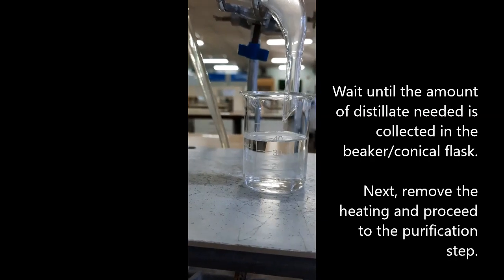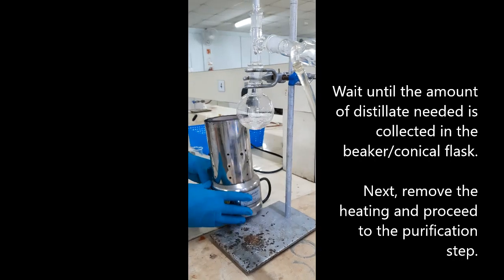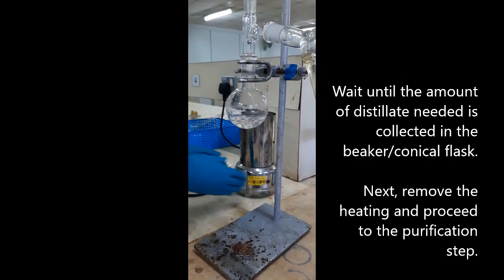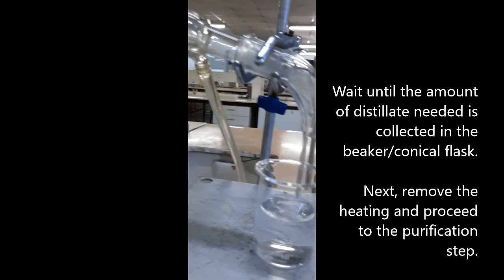Switch off the thermal heater to stop the distillation and move it away from the round bottom flask. Proceed to the next step.